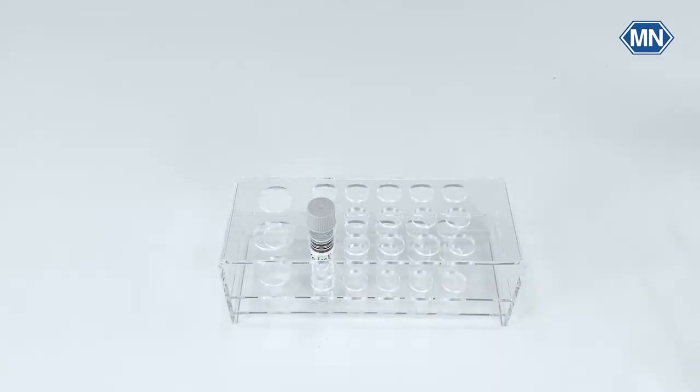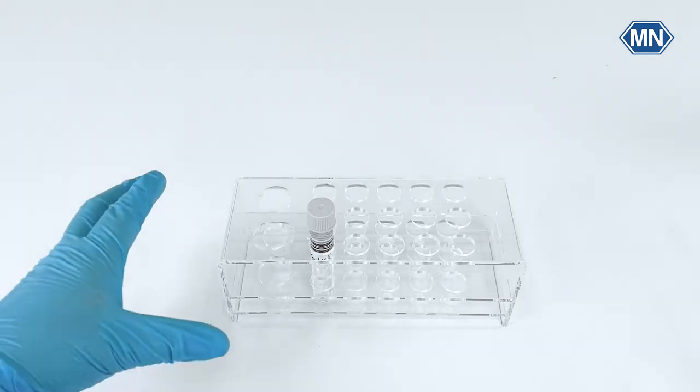Incubate in a water bath or an incubator for 5 days at 20 plus minus 1 degree Celsius in the dark. As an alternative put it in a dark room with a room temperature of approximately 20 degrees Celsius.